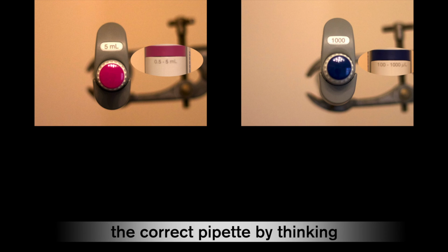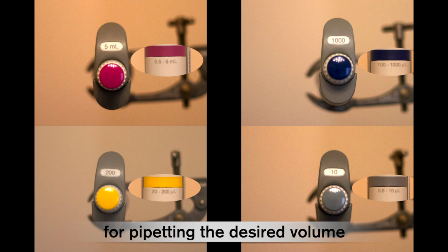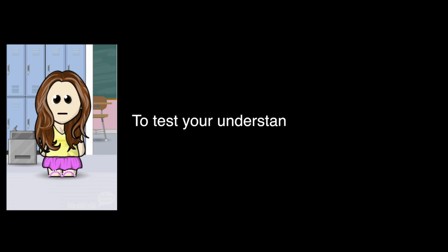It is important that you always select the correct pipette by thinking about which one is suitable for pipetting the desired volume. Attempting to adjust the pipettes outside of their volume range will damage the unit. To test your understanding, please complete the short quiz on the KLE.